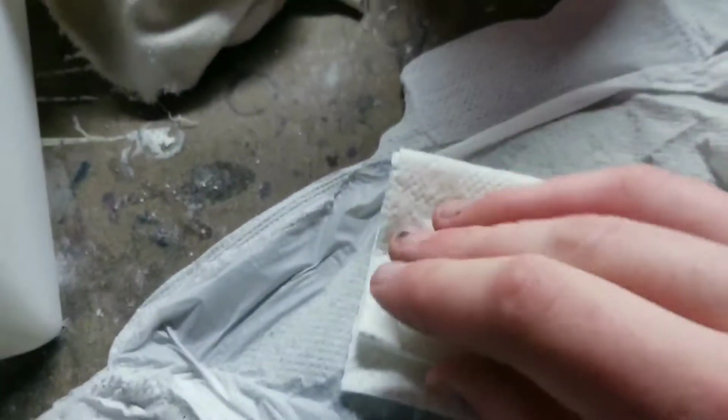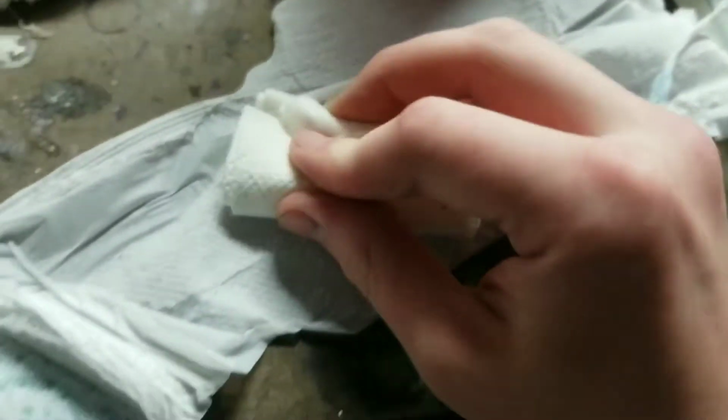Okay, so I'm going to put this guy inside of this guy, and I'm pretty sure this will do. Just got to shove it in there now. Okay, good. That seems like a nice fit. Now, my water's kind of cold now, so I'm gonna go and get some more hot water from my water pitcher.